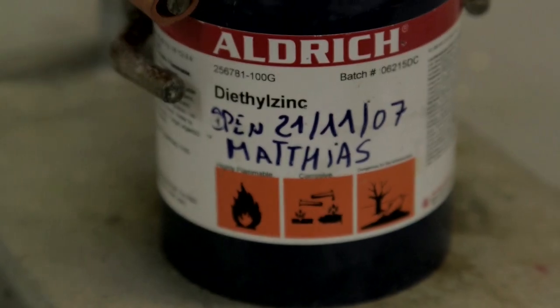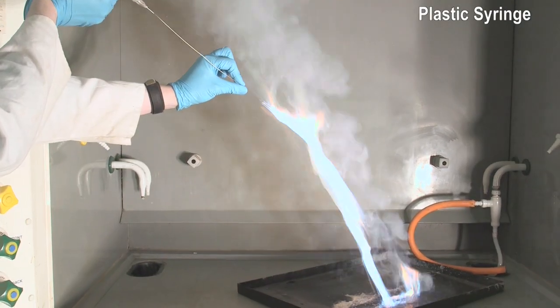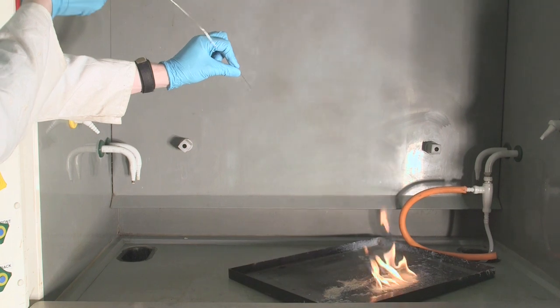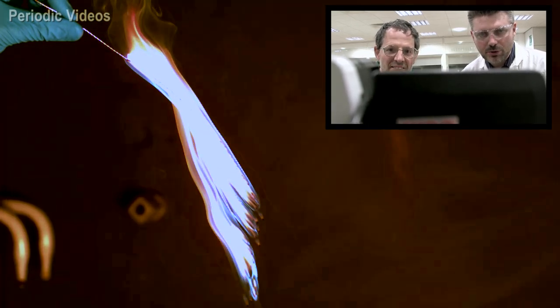What are you doing now? I'm going to do it again. My passion for diethyl zinc comes from the phrase we use: pyrophoric. Pyrophoric means it spontaneously catches fire in air. There we go. There's a bit of blue, just a few drops.